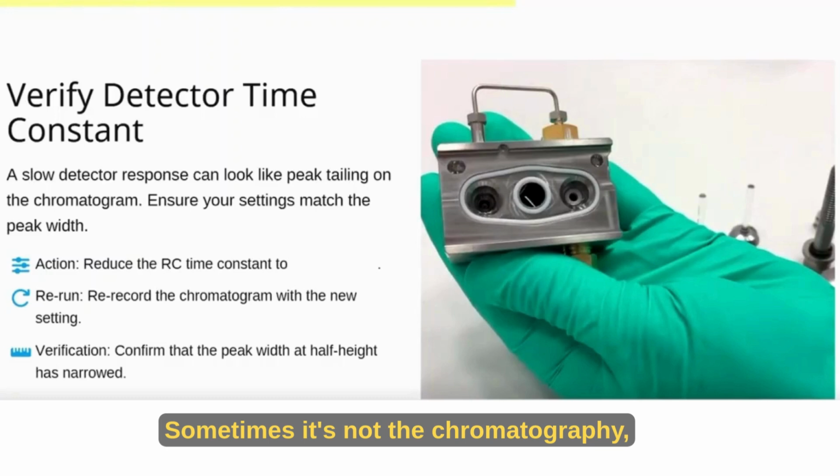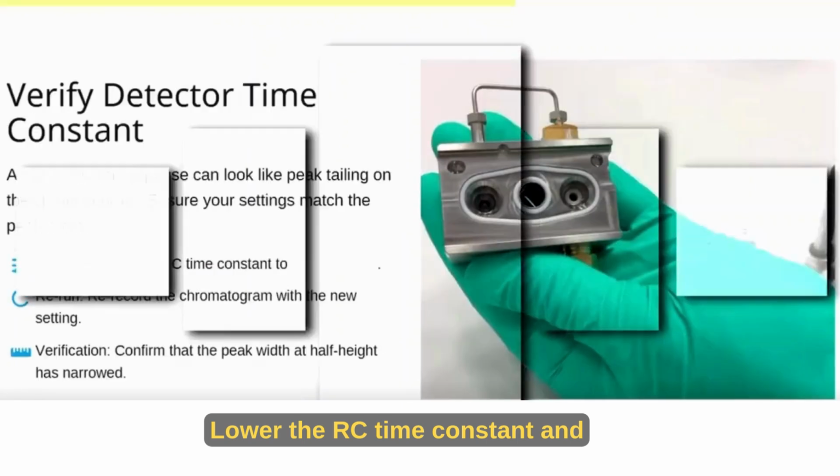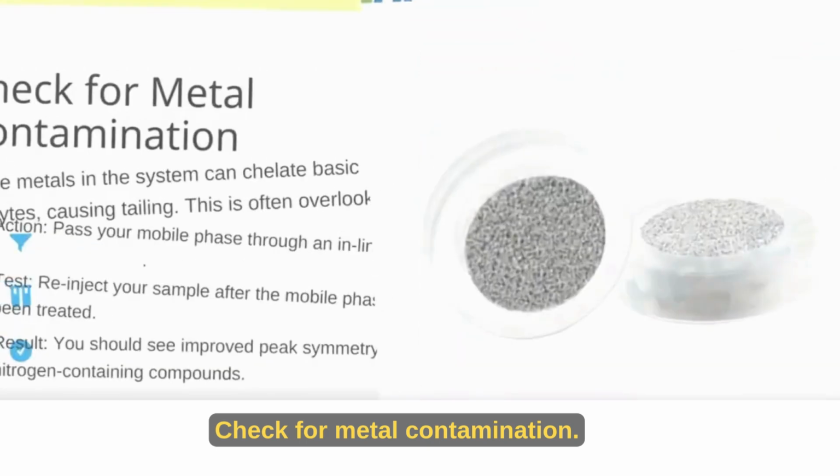Verify detector time constant. Sometimes it's not the chromatography, it's the detector. A slow detector response can make peaks look like they're tailing. Lower the RC time constant and you'll see the true, narrower peak shape.